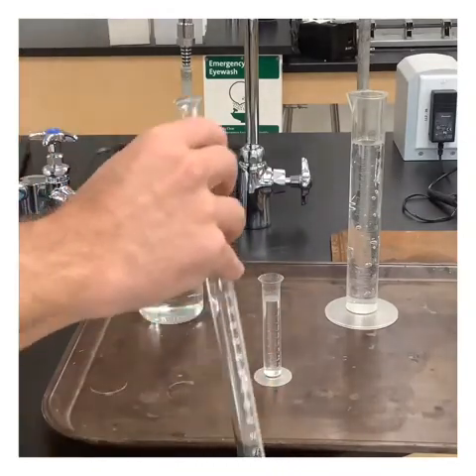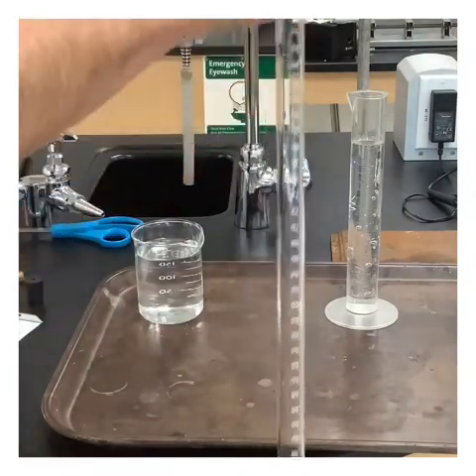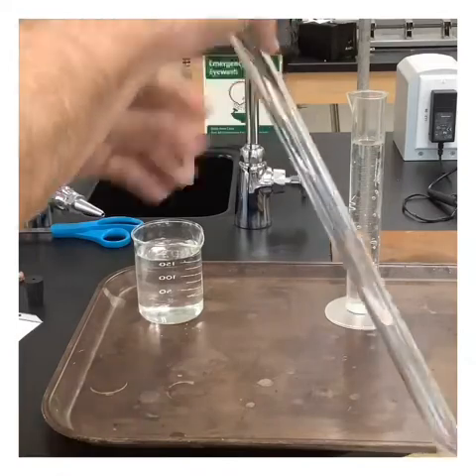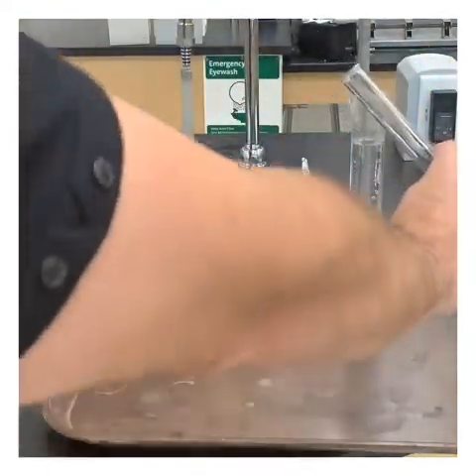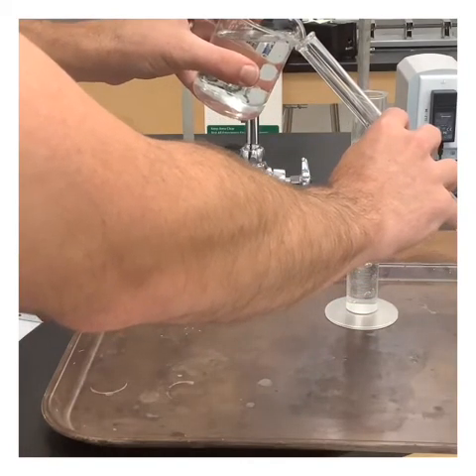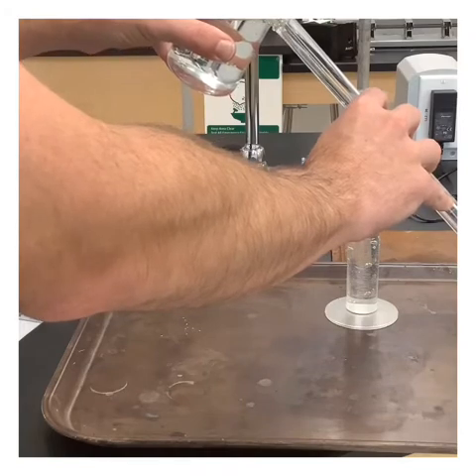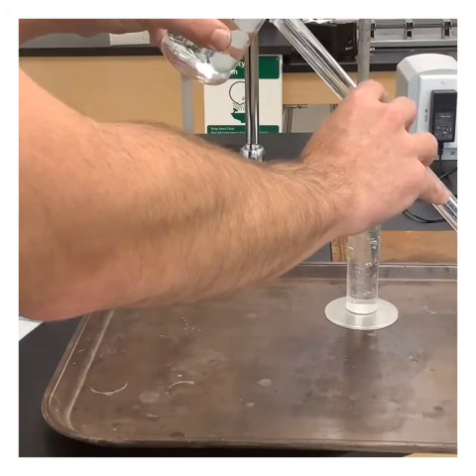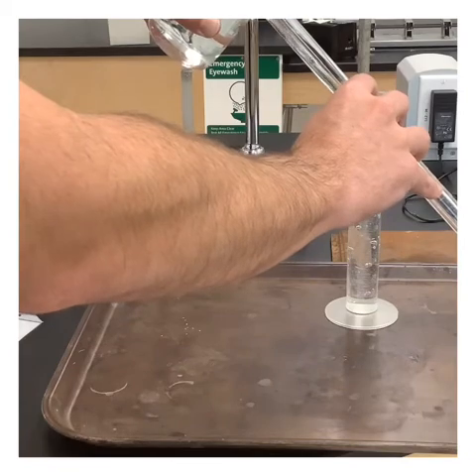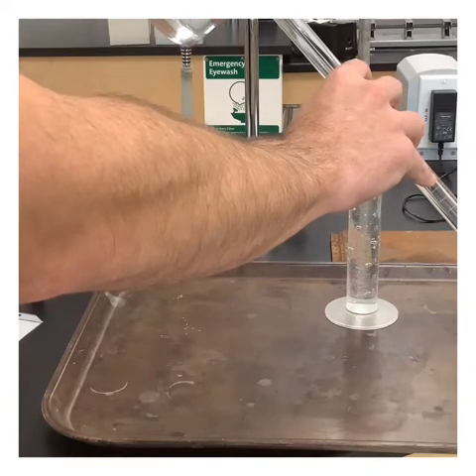So let's go ahead and get our acid in here. We're going to put the acid in first. That's the 6 molar HCl. Like I said, that's kind of nasty stuff. You don't want to get 6 molar HCl on you. By no means do we want to get that on us. Now I'm going to gently tilt this and slowly add some water to it so that hopefully I don't allow it to mix too much. I want to fill this up to the very top. Keep pouring here. So all of my acid should be at the bottom with a little bit of water up at the top.